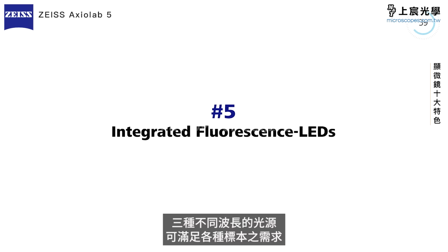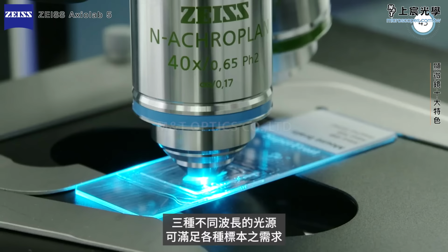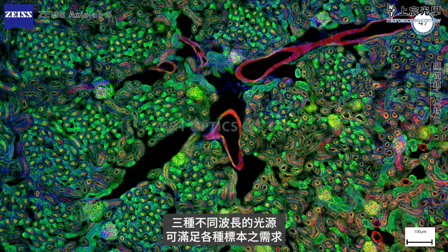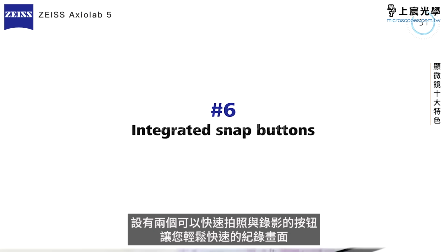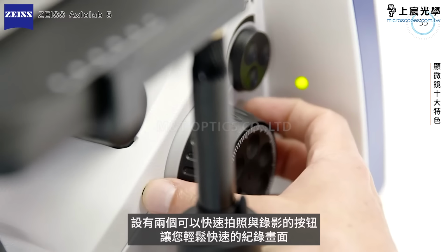Up to 3 encoded internal fluorescence LED positions allow to individually excite dyes with single bandpass, as well as multi-bandpass fluorescence filters. 2 integrated, ergonomically positioned snap image buttons allow to acquire images and videos directly from the stand.